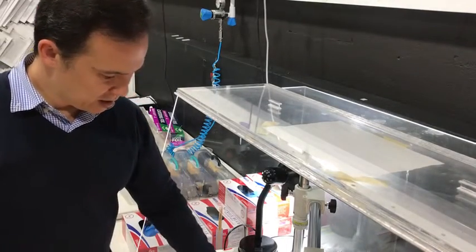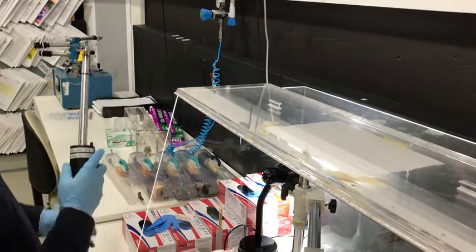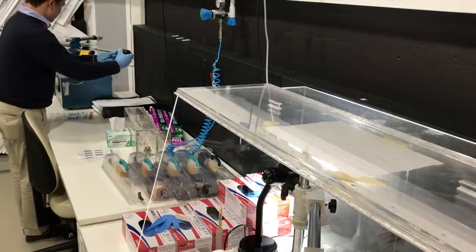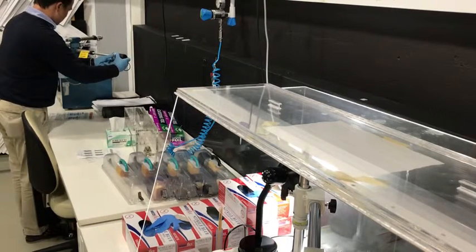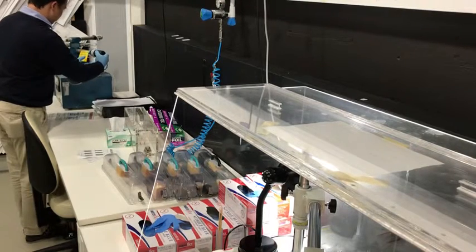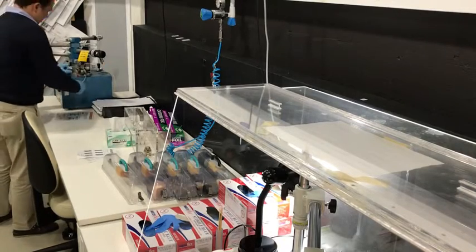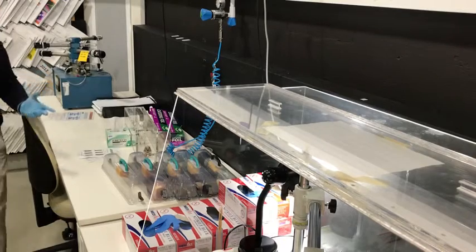No need for plasma cleaning because we're not putting a new specimen into the microscope. So now we can just place the specimen holder gently back in its housing. $50,000 worth of holder. So have to be super careful. Open up the valves, start the pump. And that's the specimen put away.